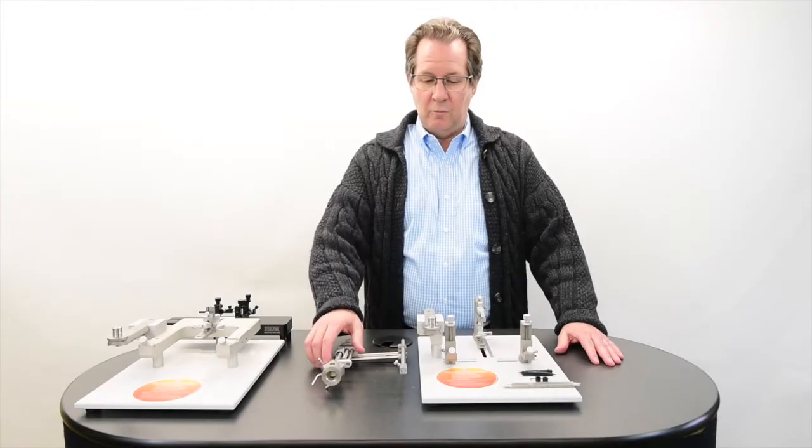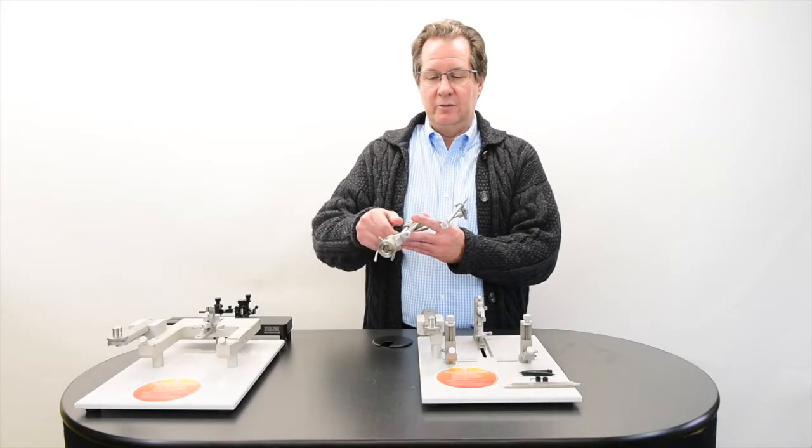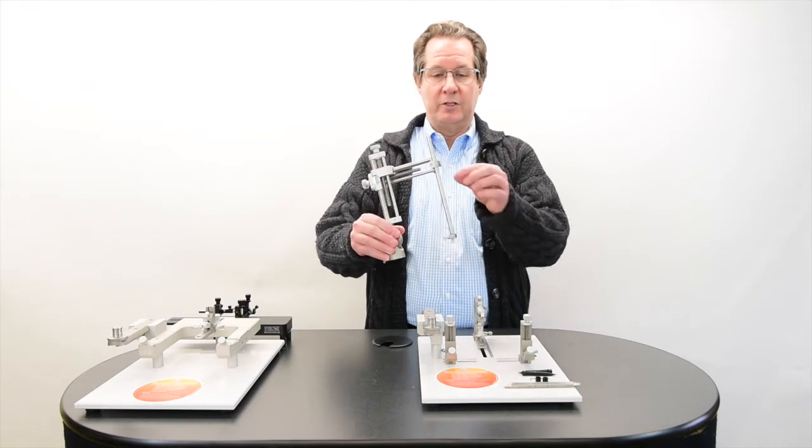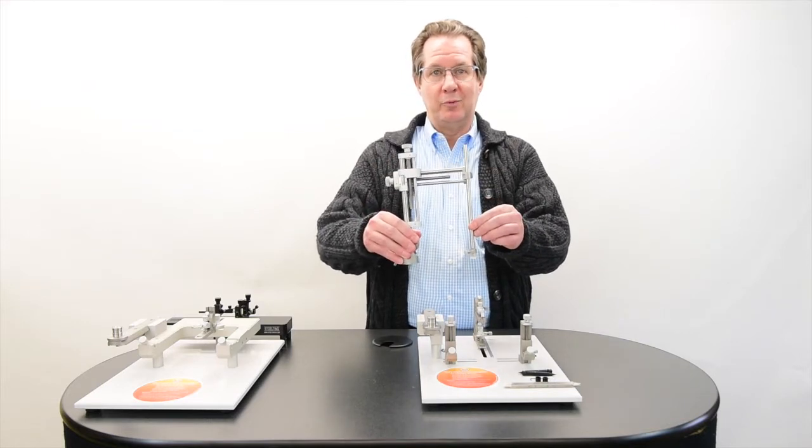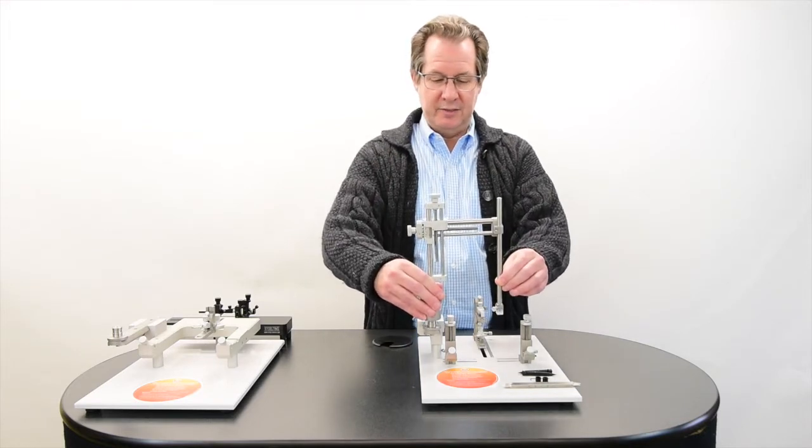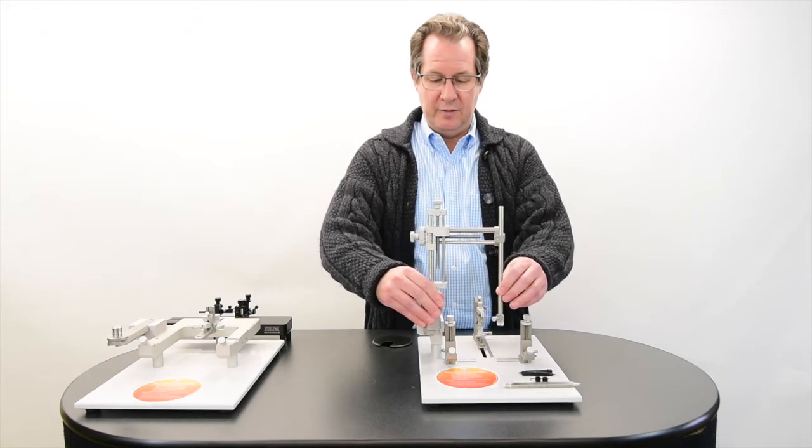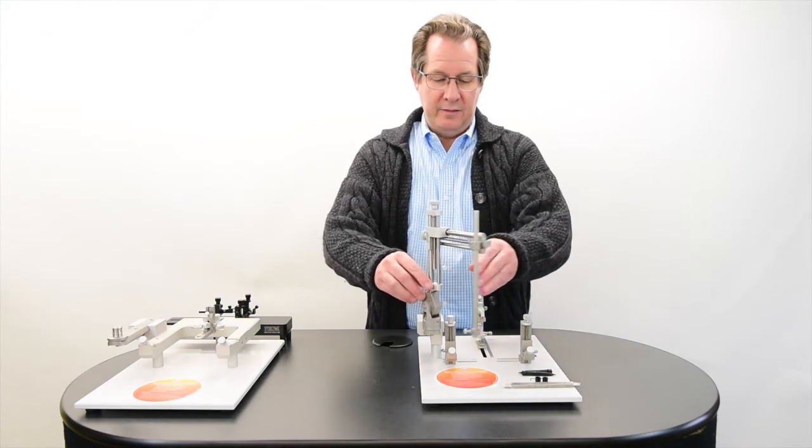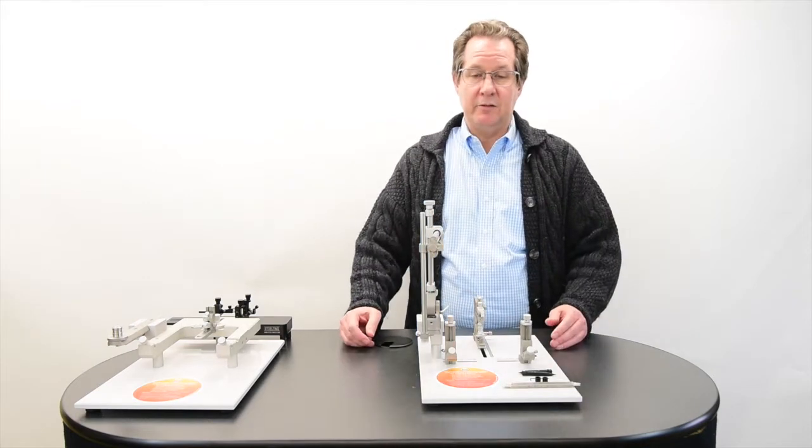Okay, so to put this together it's quite easy. All you need to do is take the manipulator arm which comes with your standard corner clamp probe holder, and this simply sits right here on top of the anterior posterior arm. Then you have on this particular instrument, this is meant to be used with mice or rats.